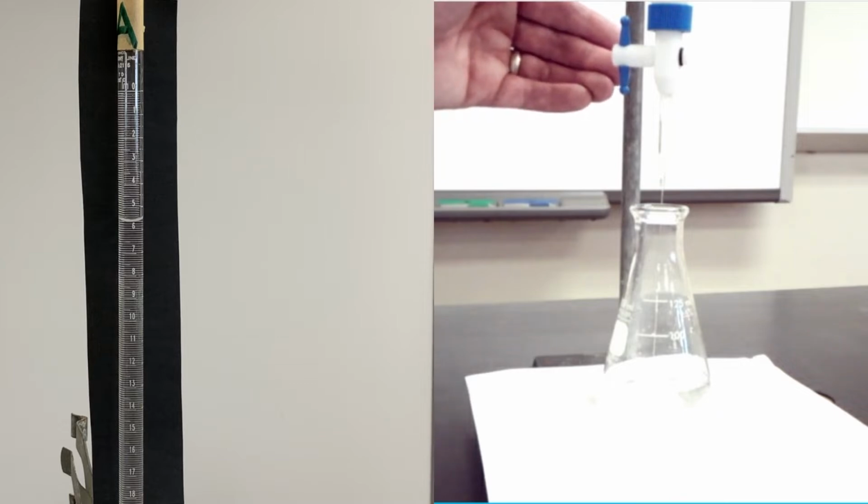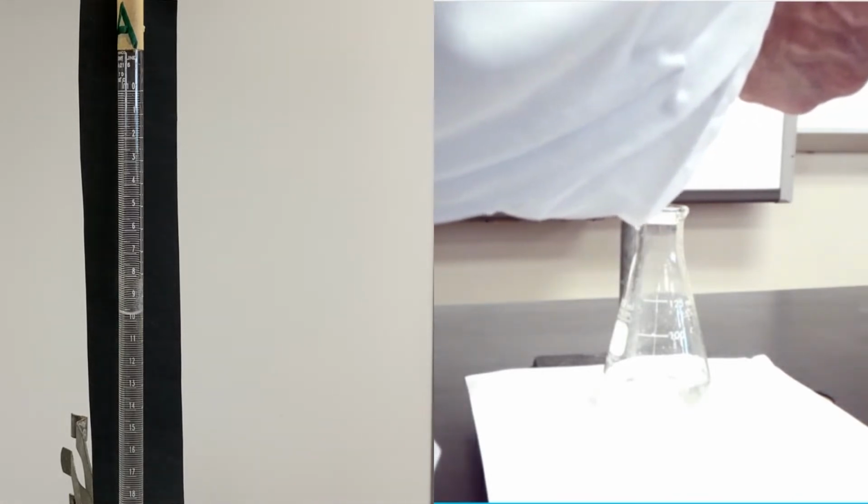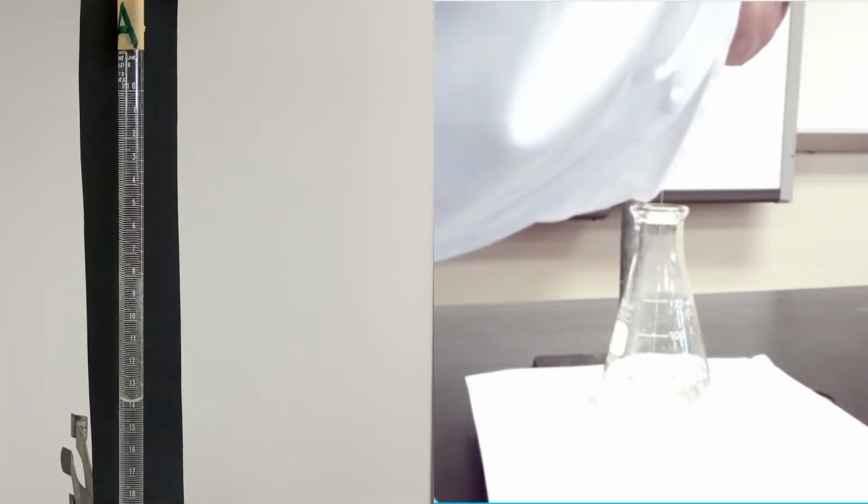I'm going to go ahead and add my acid. I'm going to open that stopcock all the way. No need to swirl right now because I'm just concerned about getting my 15 milliliters of acid in there. I put a little black piece of paper behind the burette, so hopefully you can see the milliliters that are being added here. I'm gonna slow it down a little bit more as we get closer to 15. And remember, I'm shooting for that 15.3.